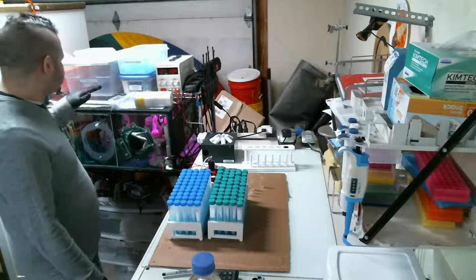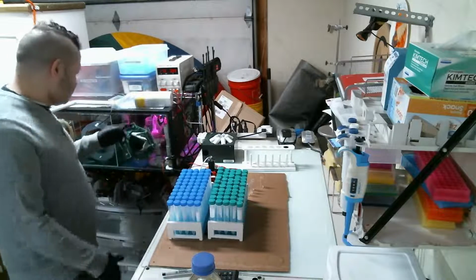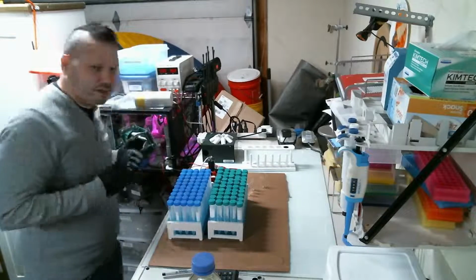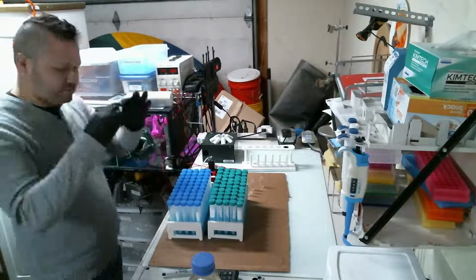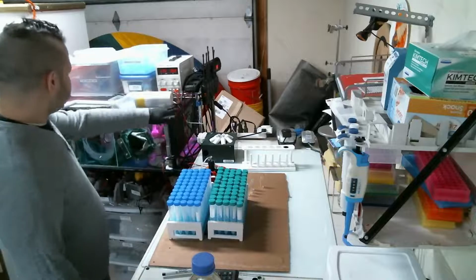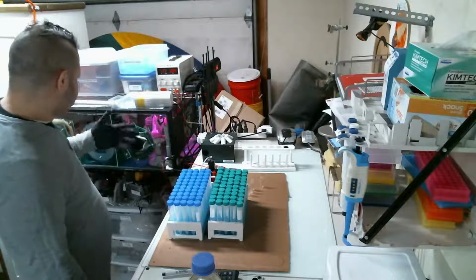So what I'm going to do is have lighting over the entire incubator. One of the issues is not just that I have a small light, it's that the frame that holds up the light takes up a lot of space. Not really a lot, because it's only two little leg areas, but it's in the way. So if I can remove that and put a large light on top that will cover the entire thing, I can put my samples anywhere.